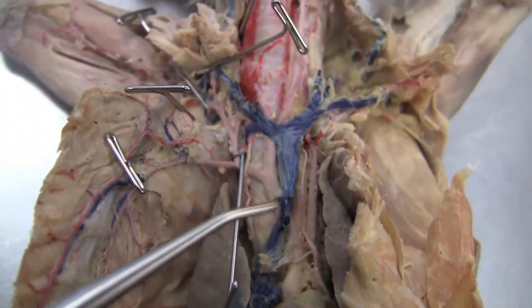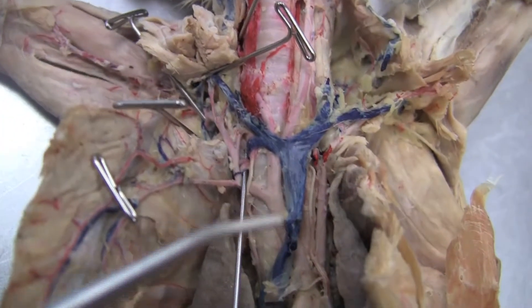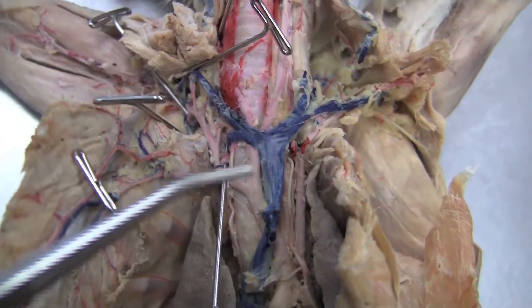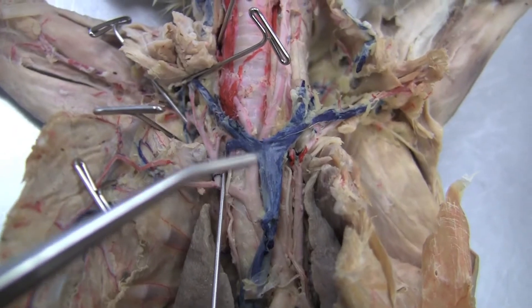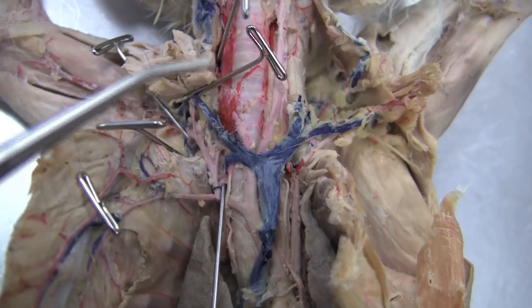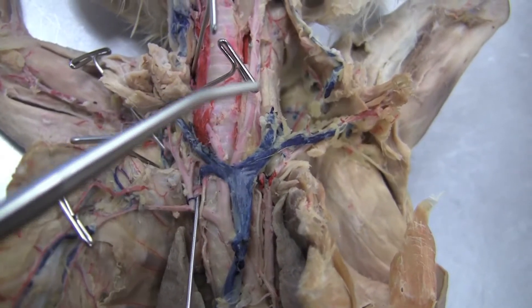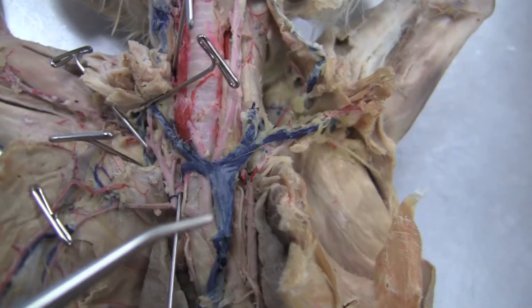Alright, going with the arteries on the right side, you're going to have the brachiocephalic right here. It's going to go up. The right carotid will branch off and the left carotid will branch off of that.